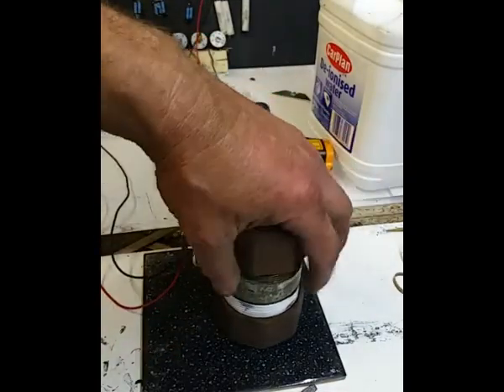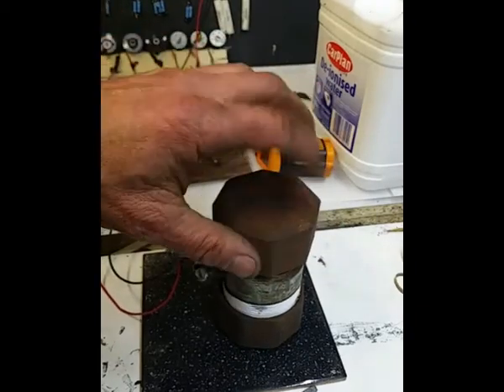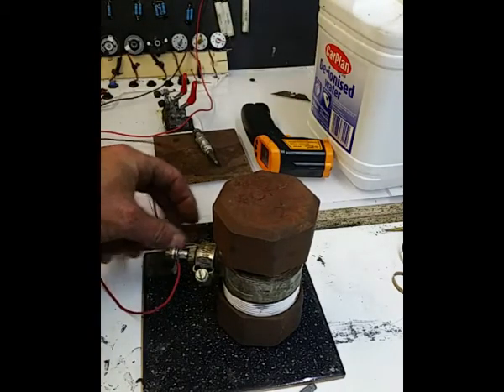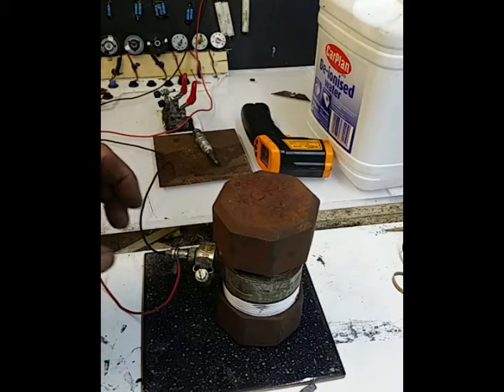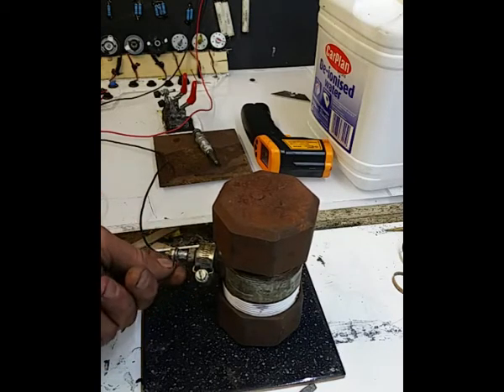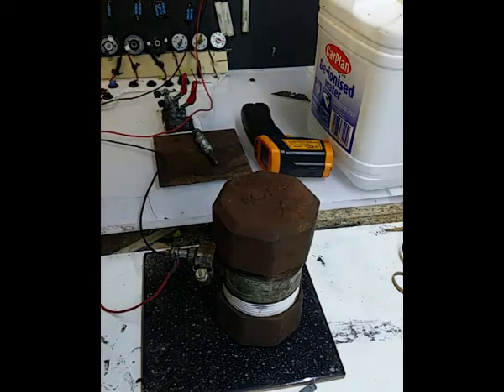It's not hot, I've just warmed it up on the hot plate. I've wired it up. It's a bit crude, I know, but it's just a preliminary experiment. So Jubilee clip for the ground, and there's your positive. So what I'm going to do is turn on the power supply.